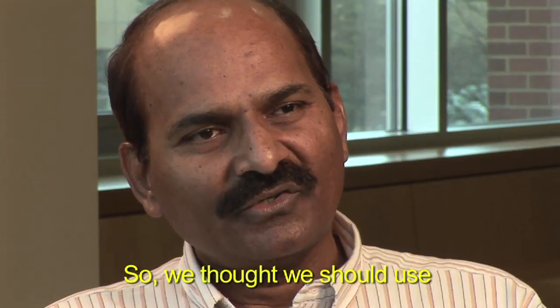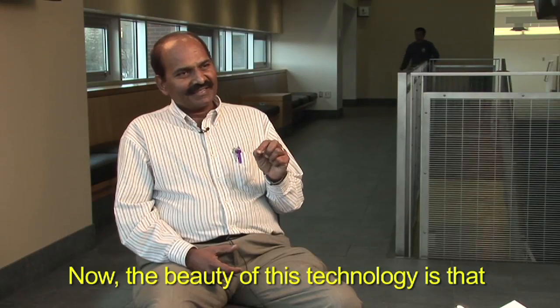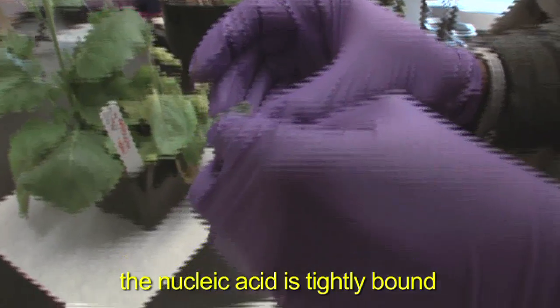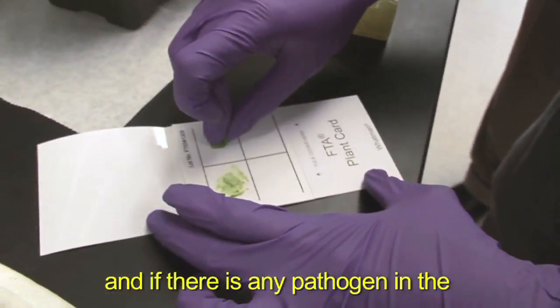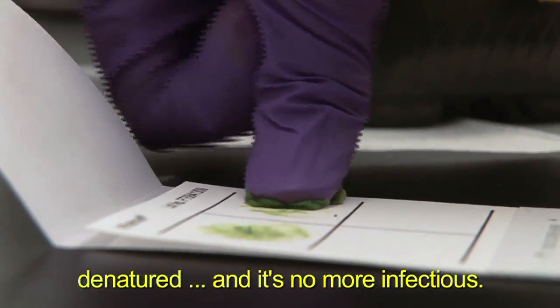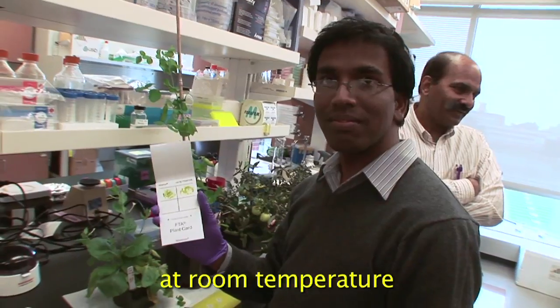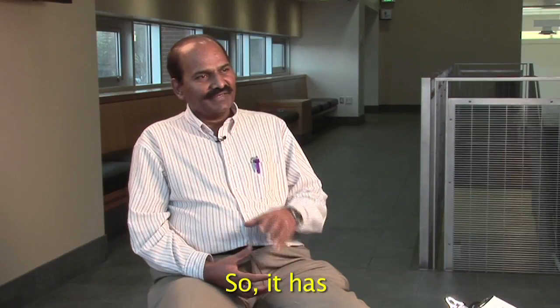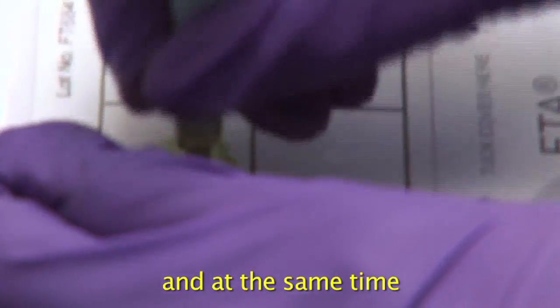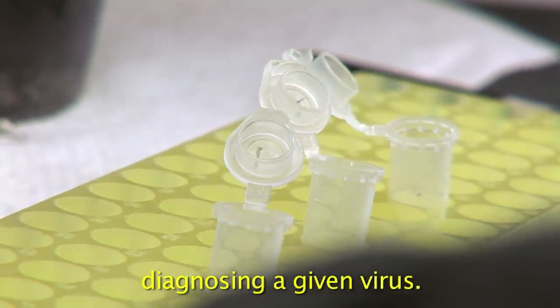We thought we should use that kind of technology in our program. The beauty of this technology is that once you spot the sample on this FTA card, the nucleic acid is tightly bound, and if there is any pathogen in the sample, it's denatured and it's no more infectious. These cards can be transported at room temperature through regular mail, so it has the advantage of convenience, simplicity, and at the same time maintaining accuracy and precision in terms of diagnosing a given virus.